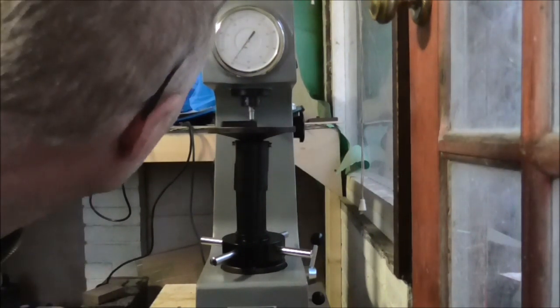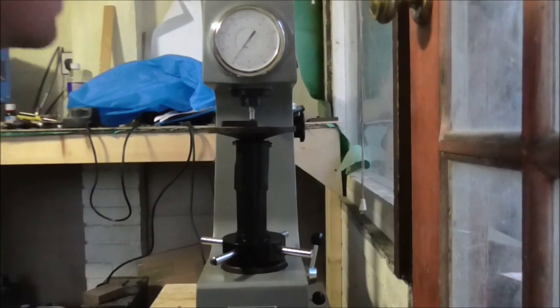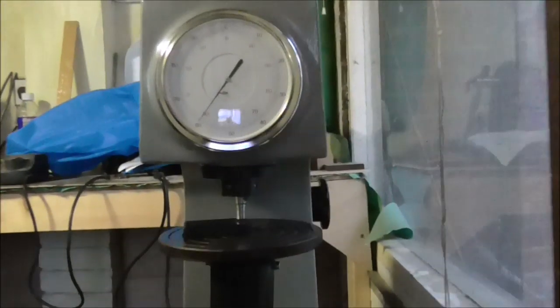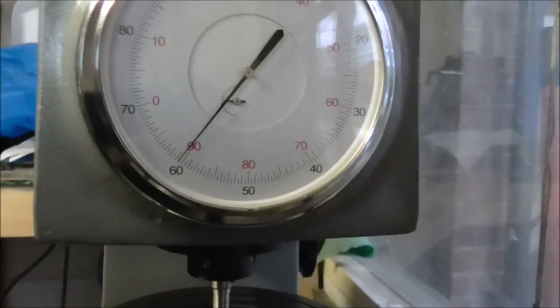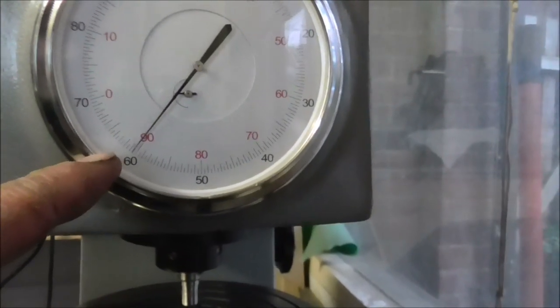And there the Rockwell reading is reading 61. I don't know if you can see that. It's reading 61 there.